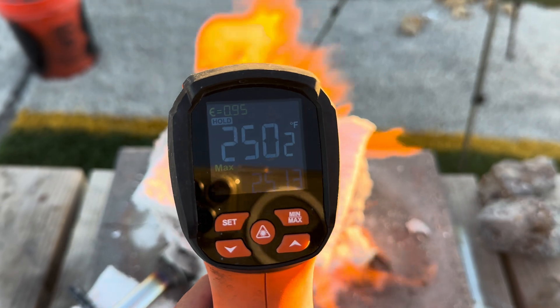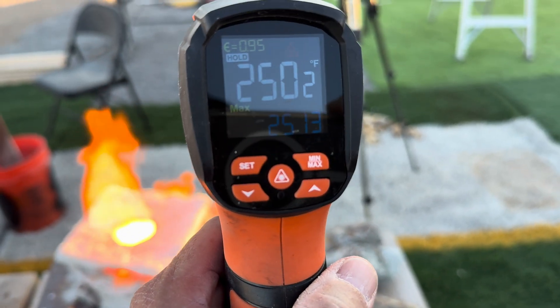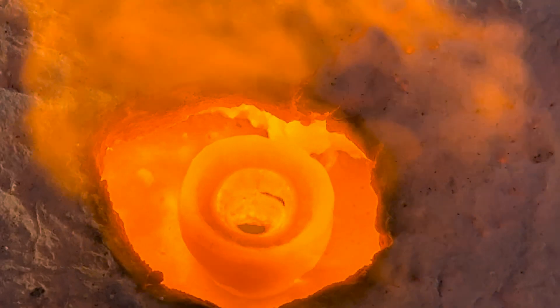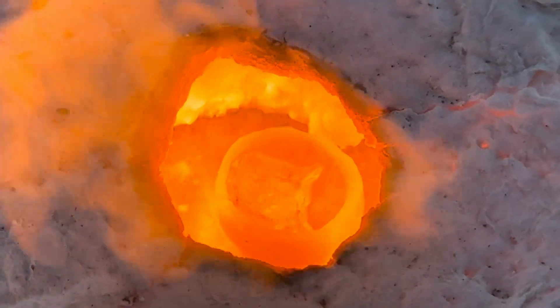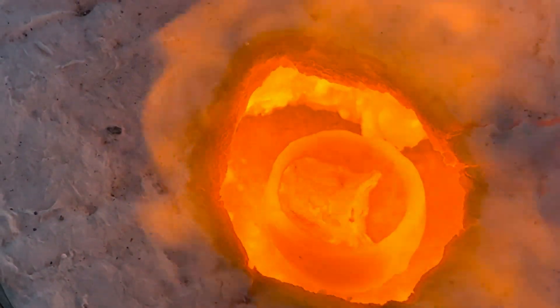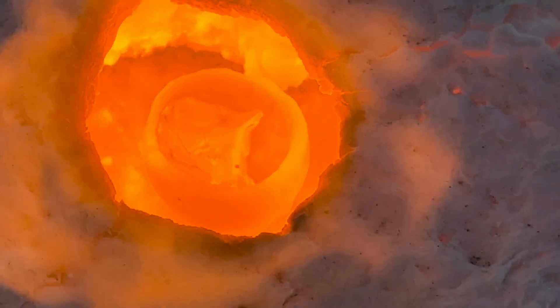We have our cupel at 2,500 degrees. With this tremendous amount of heat of 2,300 to 2,500 degrees, you can see that the cupel is now deformed as well as the prill.